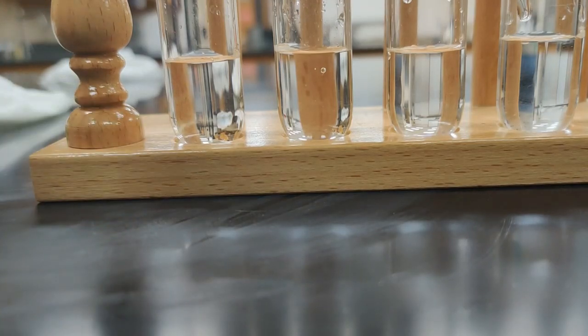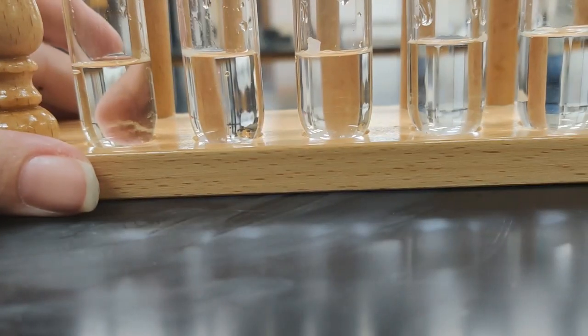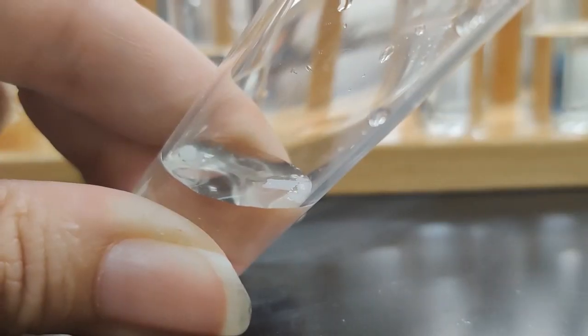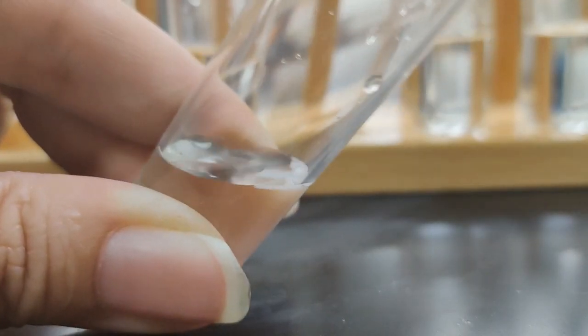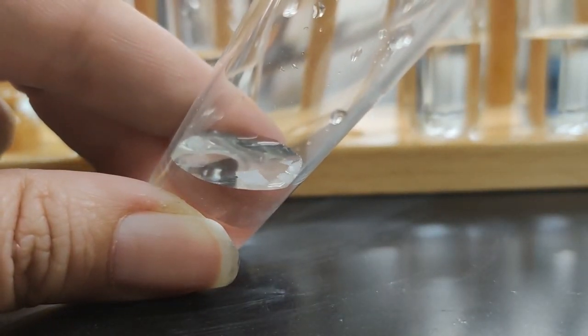So now the next thing is going to be our naphthalene, which is very smelly. A lovely covalent compound, all C's and H's. So we're just going to take a little chunk of it, drop it in there. This is my third substance. Ugh, so smelly. And again, we'll agitate it to see if we can get it to dissolve. And we can see that the naphthalene here is floating on the surface of the water. You can still see that chunk that I put in there right there on the side, kind of floating around on the top of the water. Let's see if I can change the angle, see it moving.